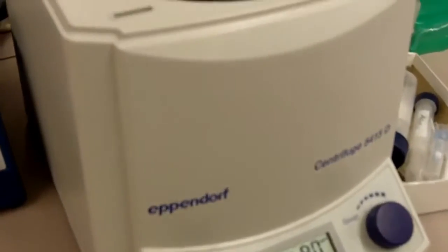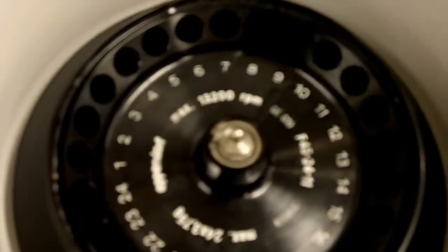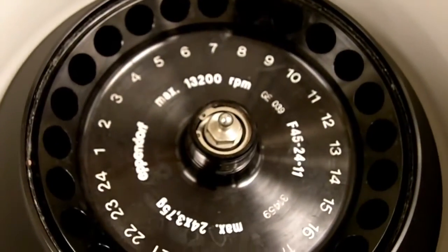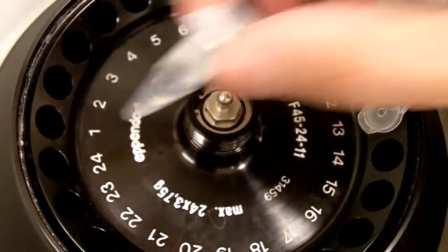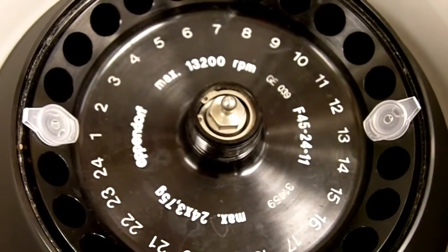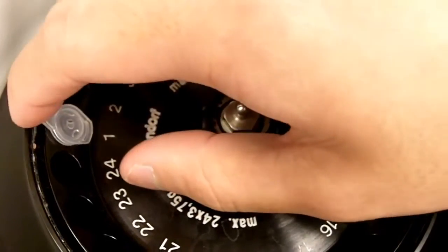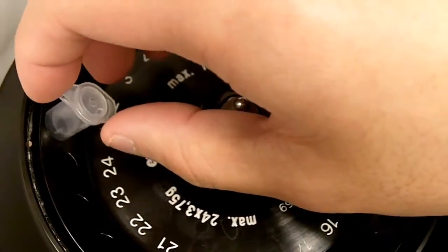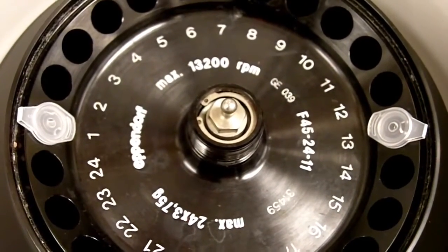Now I'm going to show you how to balance your samples in a centrifuge. We are looking at a centrifuge rotor right now. You have to place your samples directly across from each other. That's how you balance it. If you only have one sample, you can take a second tube and fill it up with the same volume of water, then you will have your centrifuge balanced.